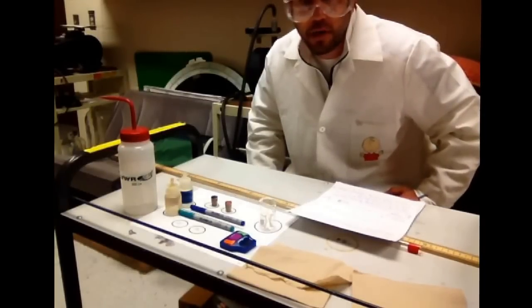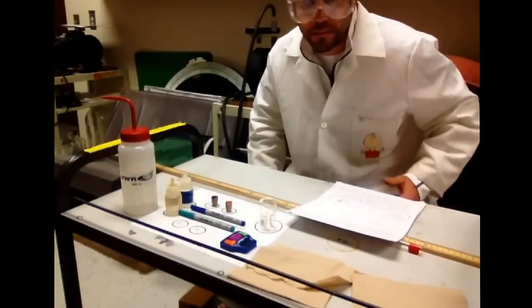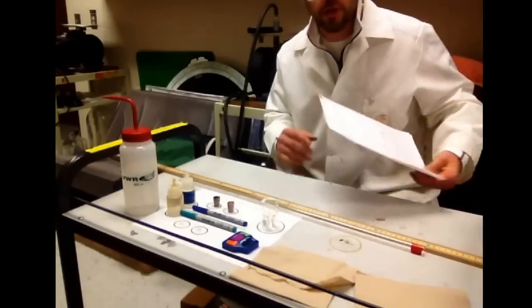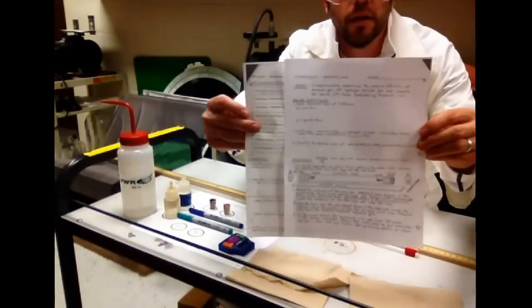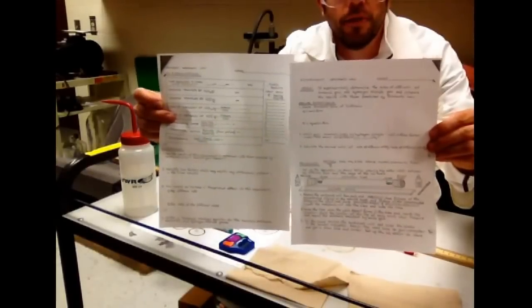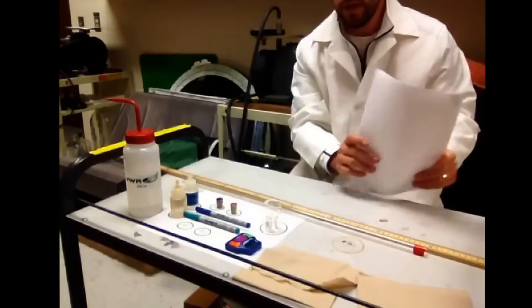Today we're going to be looking at Graham's Law and I'm going to show you the lab procedure and some of the safety concerns. As you take a look at your lab, these are the two pages that go hand in hand in your packet and you'll be using those as we fill out the lab.